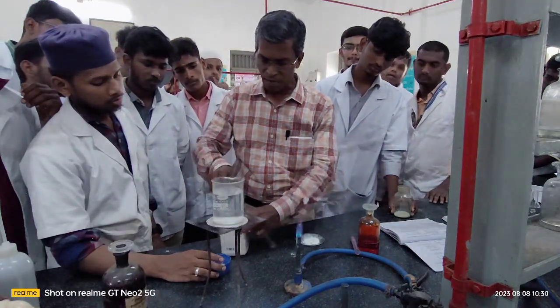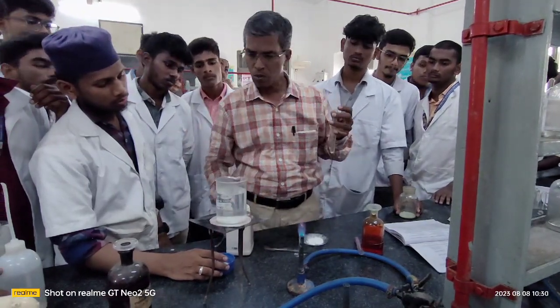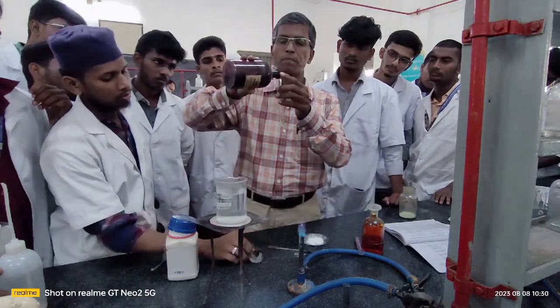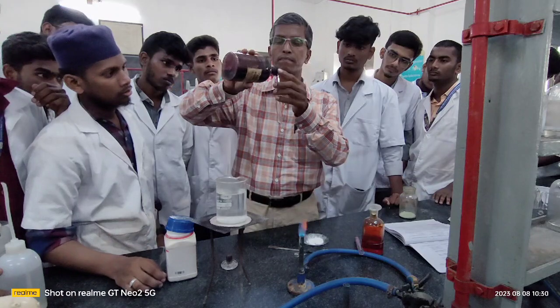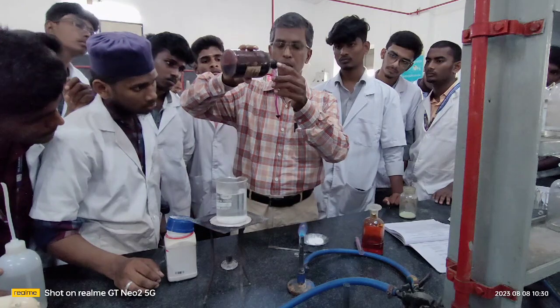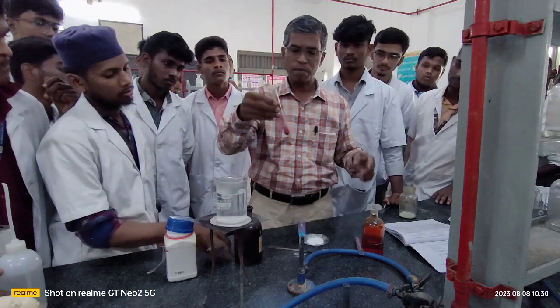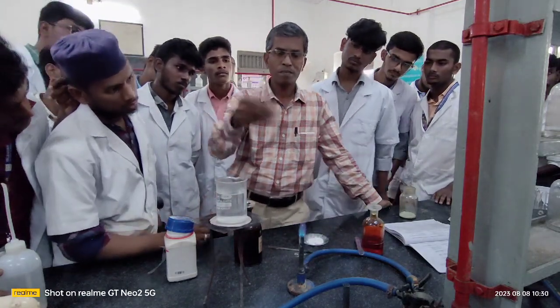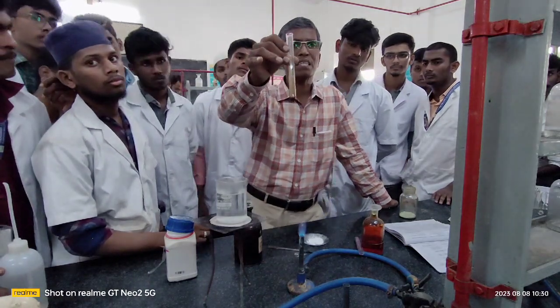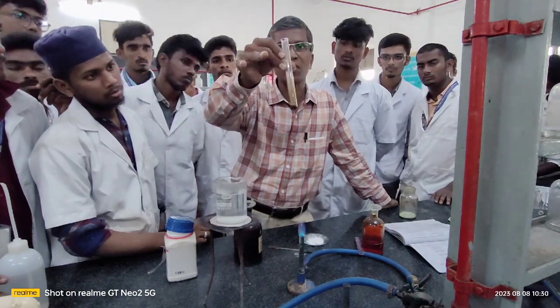Take a little of the given organic compound into a fresh, clean test tube. To this, add the same potassium permanganate, a little extra as you did previously. You had better use your dropper tube and see what happens. See here, the color disappeared. The original color is not this one. See here, a change of color has taken place.